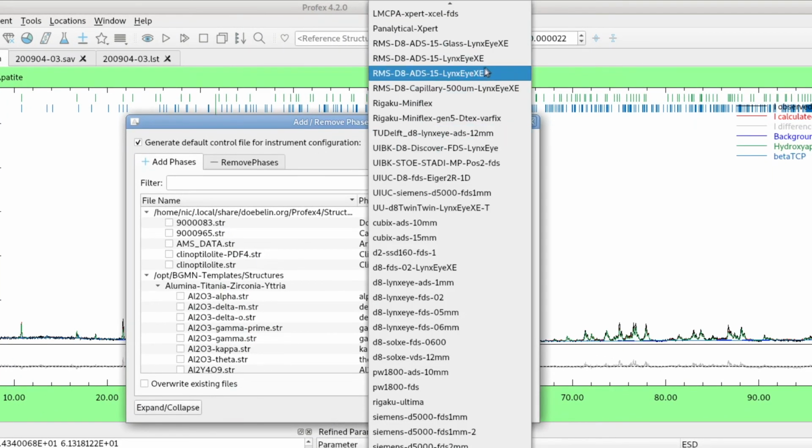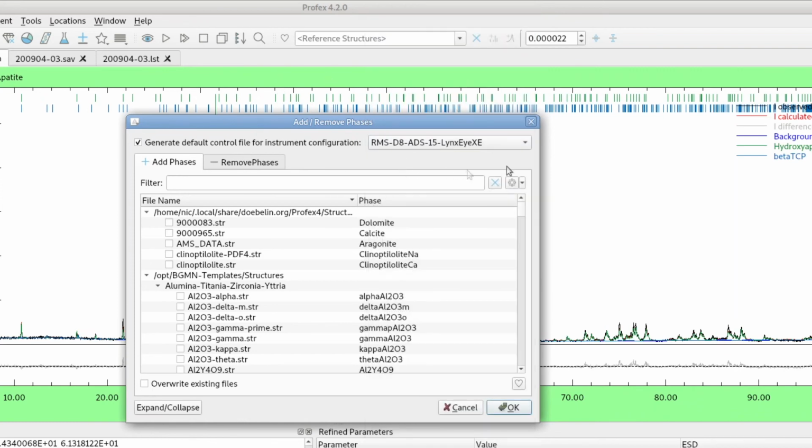I should have given a different name because now I don't know which one is the original one and which one is the extended one, but they appear both in this instrument list.